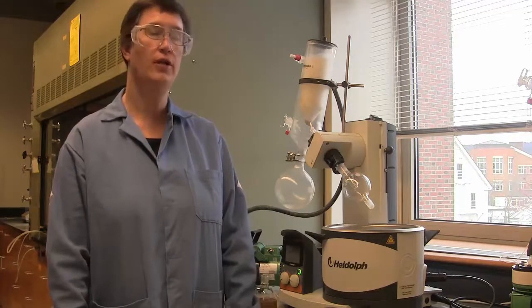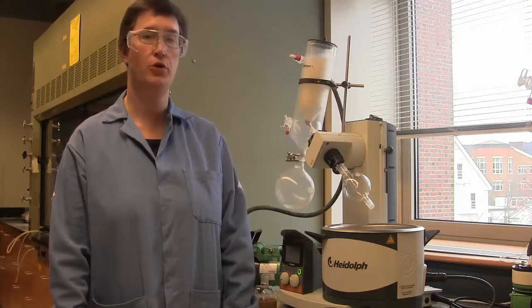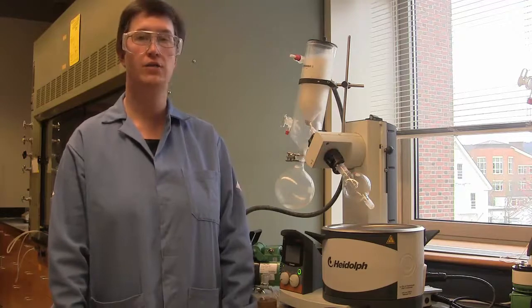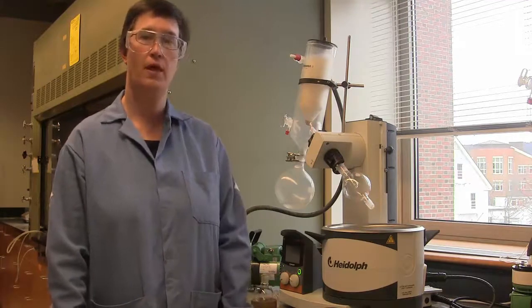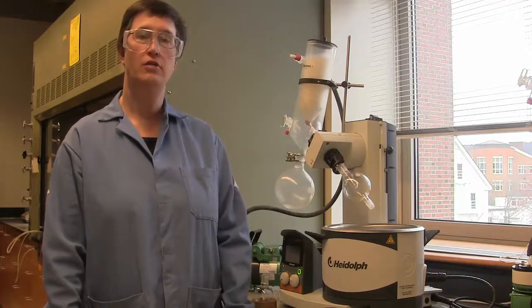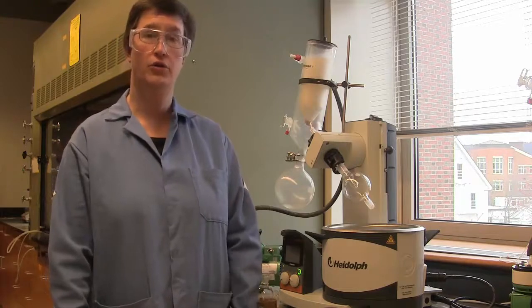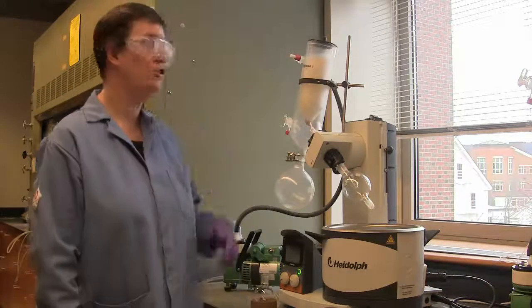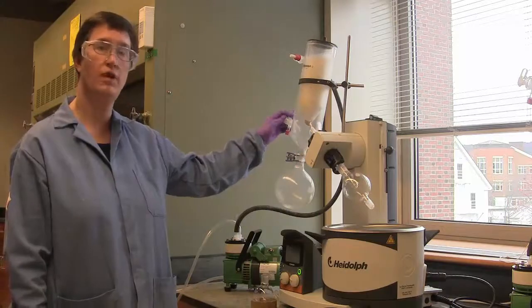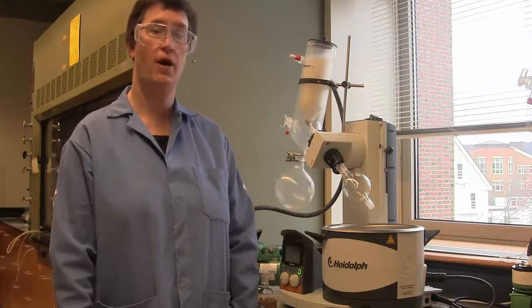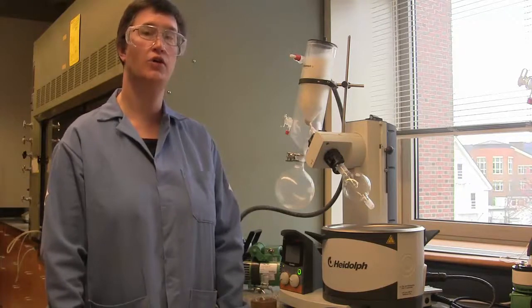If you are using the rotovap properly, then evaporation should begin within just a minute or two of placing the round bottom flask on the rotary evaporator. If evaporation does not begin within a minute or two, check to see if your vacuum pump is on. Check to see if you've closed the vacuum release valve so that the system is indeed under the vacuum provided by the pump. If you're still having trouble, ask a TA for assistance.